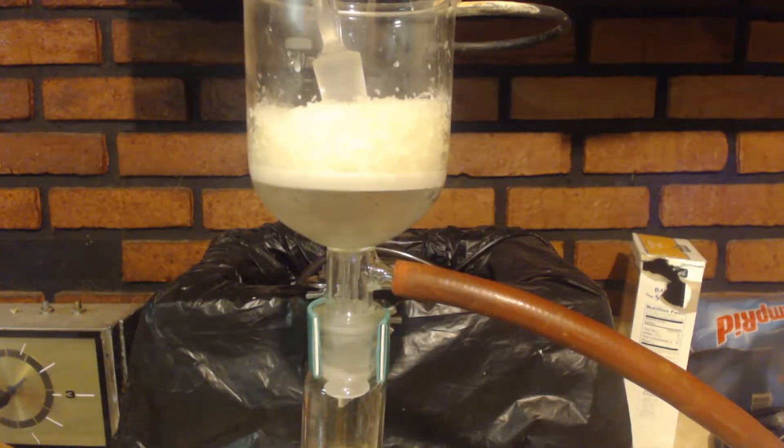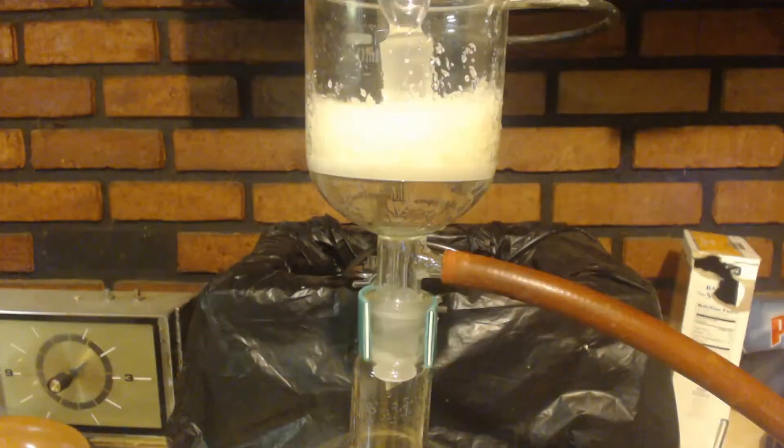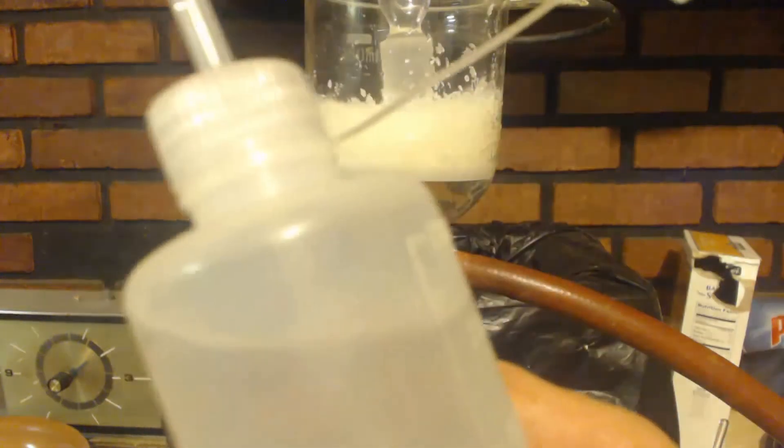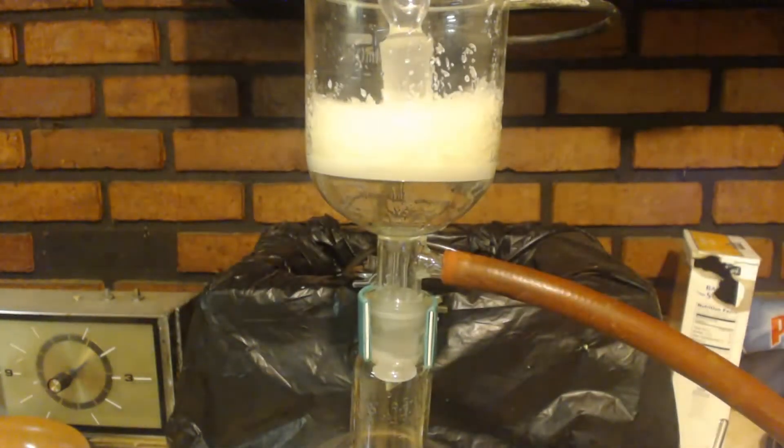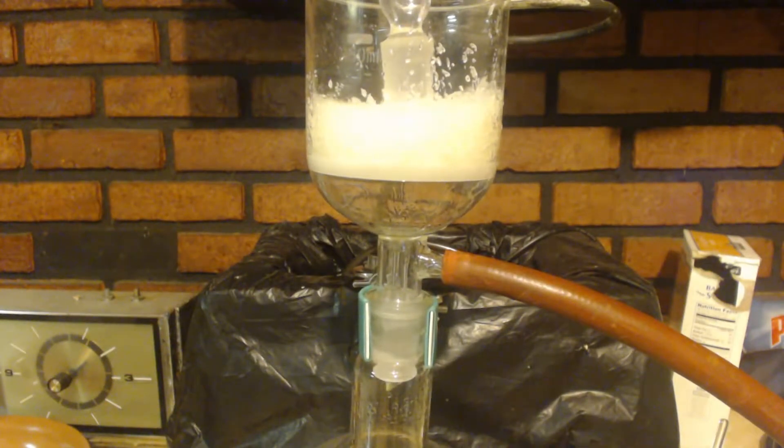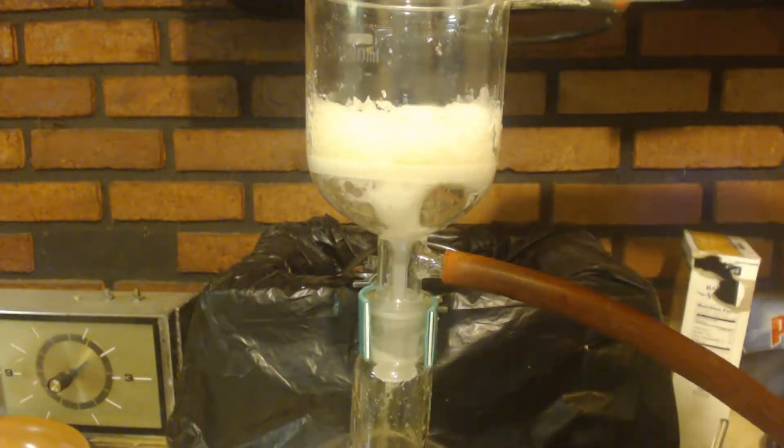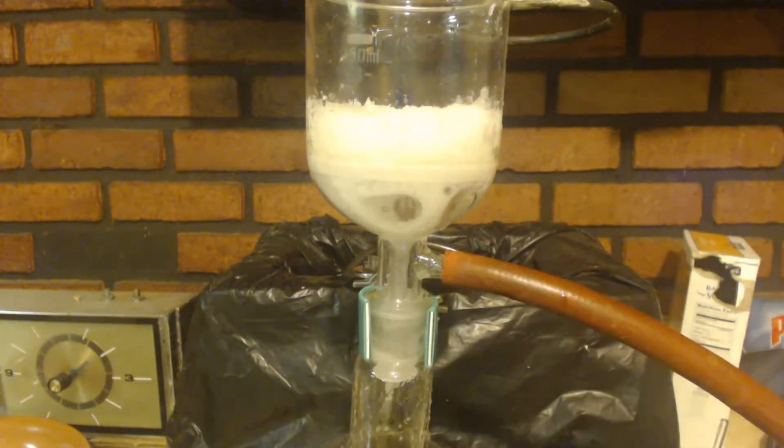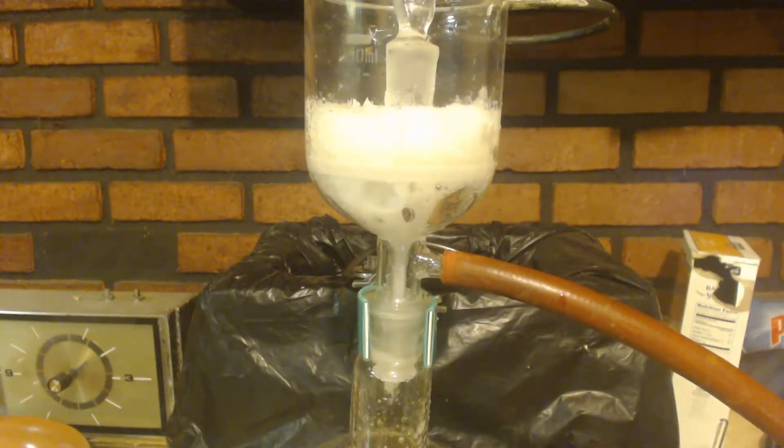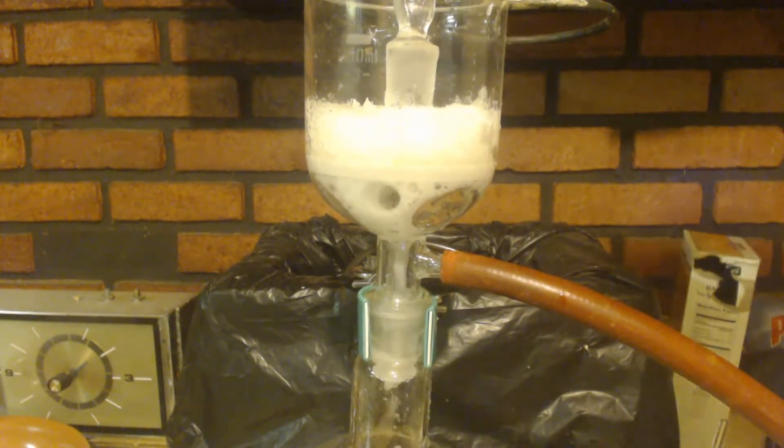I'm just gonna suck the water out with this pump. I got a little bit of ice water here. I'm just gonna turn this pump on and spray it down with a little bit of water and wash it out. I'm just gonna leave that pump on after about 10 minutes and let it dry up.